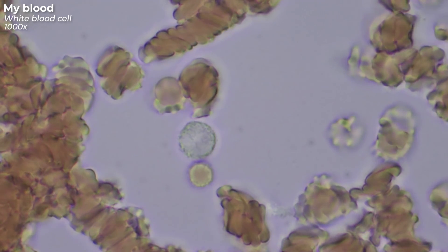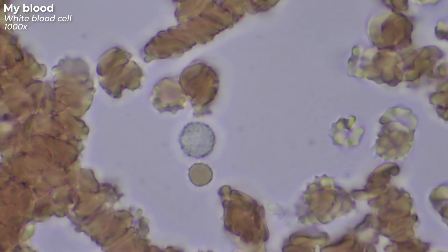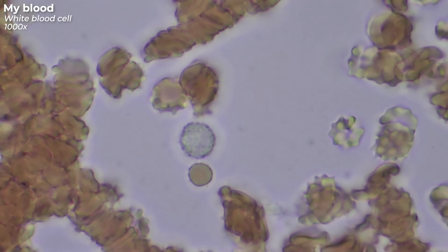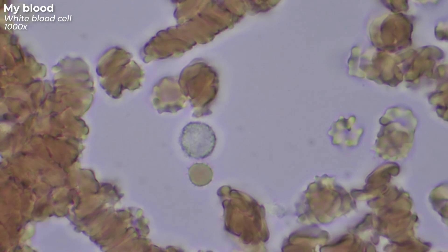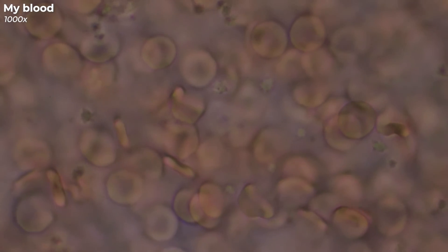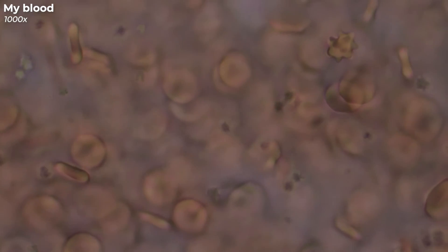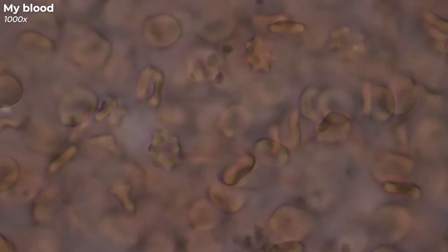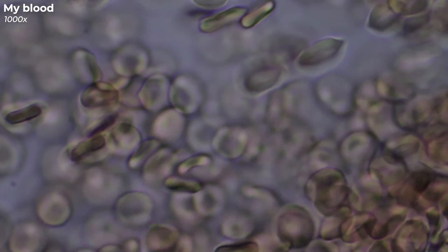And then there are the lymphocytes. They help the body's immune system fight cancer, bacteria and unknown viruses. Some lymphocytes are also called memory cells because they are able to recognize a particular antigen that they have encountered before. Therefore, the immune system can respond to them faster and stronger. If you have too many white blood cells in your blood, it can be due to various reasons — for example, it may indicate a bacterial infection, too much stress, or even leukemia. Certain autoimmune diseases, such as lupus, can be the cause of a low white blood cell count. But also viral infections or a severe vitamin B12 deficiency can cause you to have too few leukocytes in your blood.